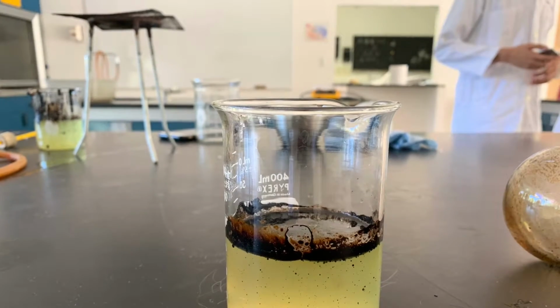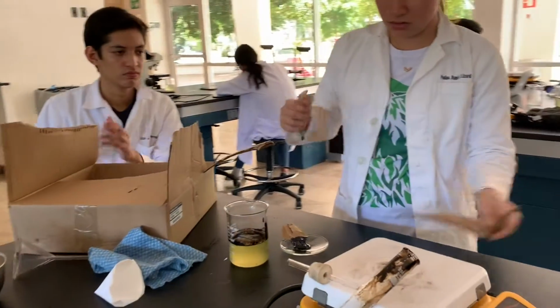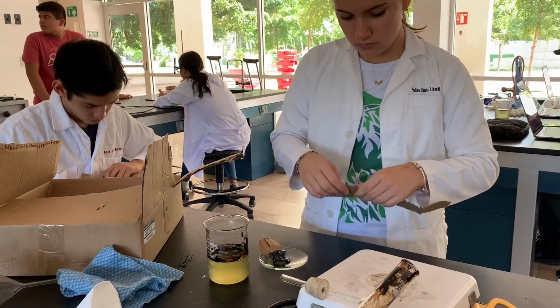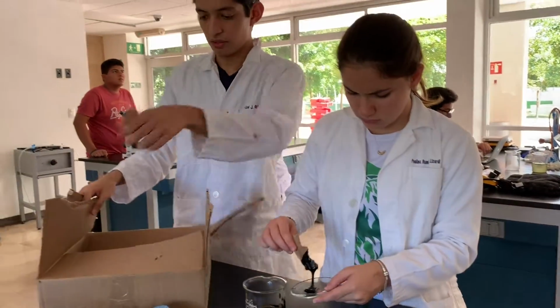The initial sample of water was clean, oil free. Its color was yellowish green, it almost seemed fluorescent. Otherwise, the water was odorless, and at least we couldn't detect any particular smell. The water pH was 8. This means that it was not 100% neutral, but a little alkaline.